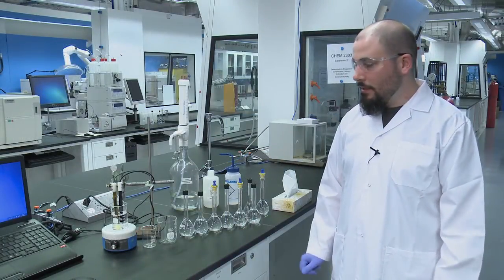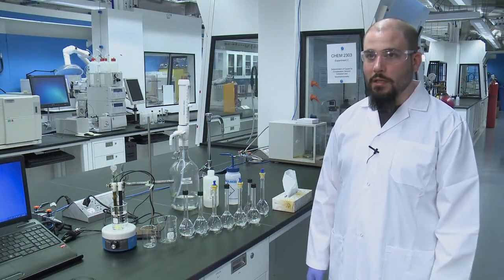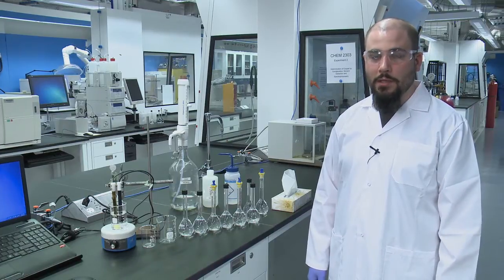Hi, my name is Adam, and this is fluoride determination using ion-selective electrode potentiometry.